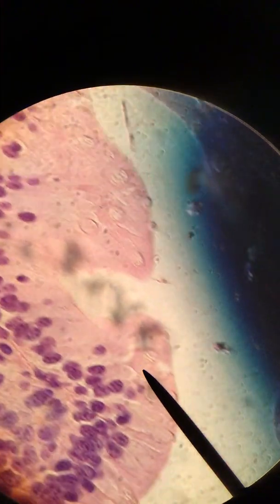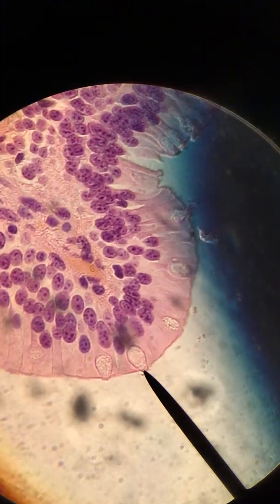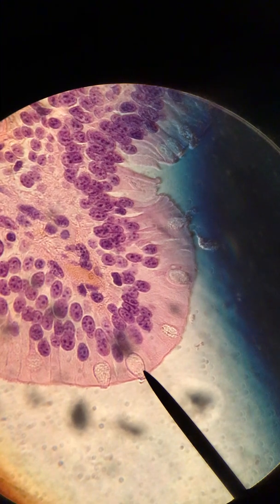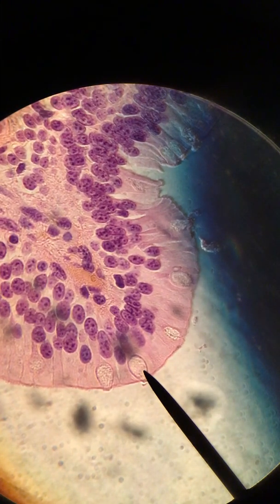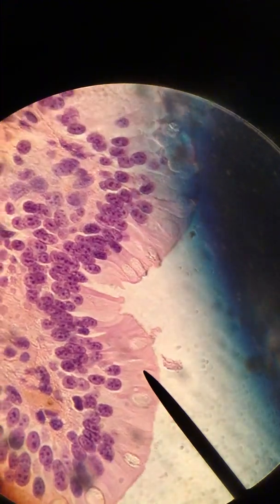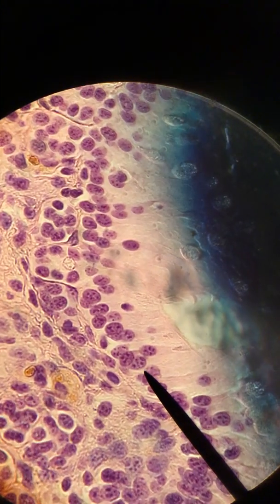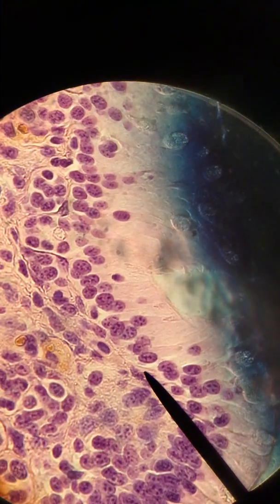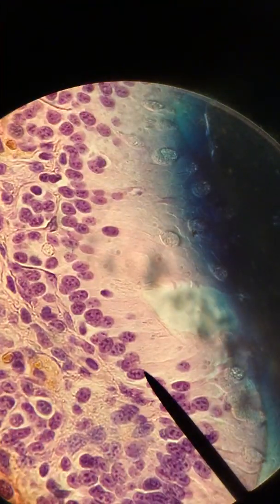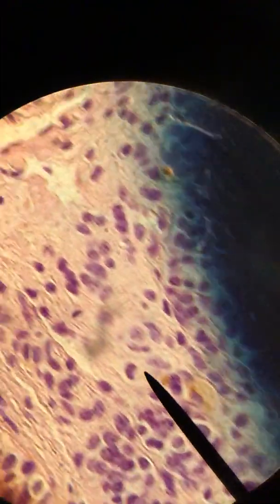All of these cells here that I'm scrolling along are simple columnar epithelial cells with goblet cells mixed in. This here is a glob of mucus secreted into the inside of the small intestine, and all the cells around that are simple columnar epithelial cells. You can see that the nuclei of these cells are all at about the same level — they're resting on a basement membrane, and the nuclei are relatively even, towards the basal end of the cells.